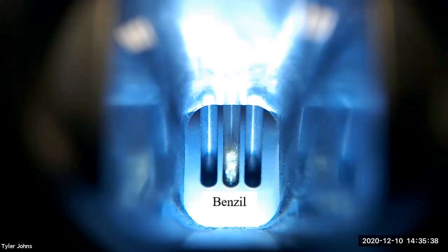We will now perform a melting point determination of the purified benzil.